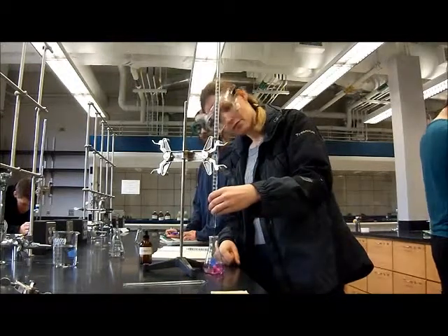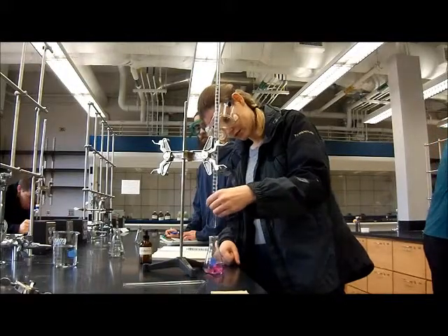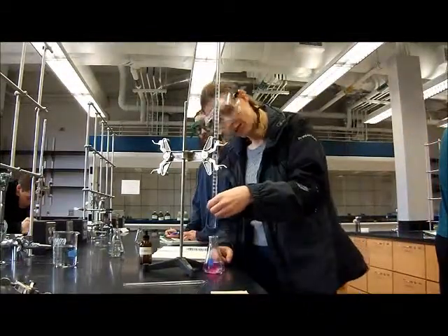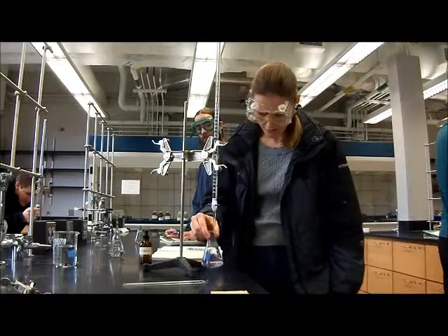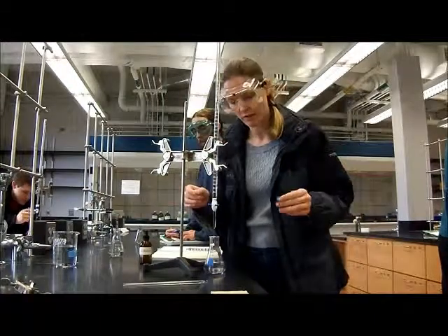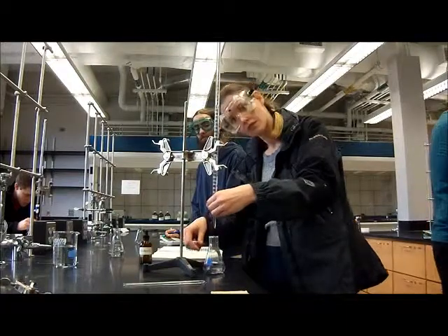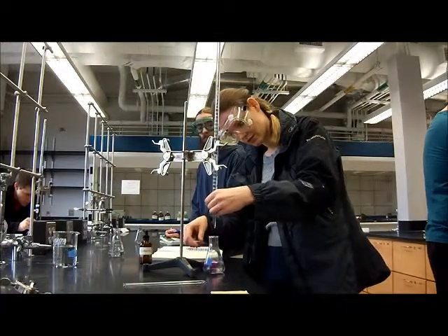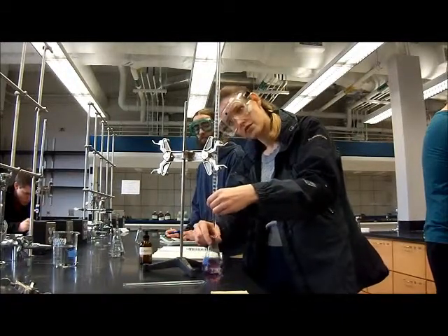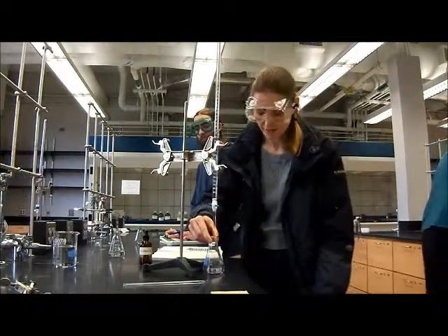So I've now gotten to about 20 milliliters of solution. And as we can see, it's still fairly clear. Okay, I've now reached 25 milliliters, and since I think the endpoint will be around 30, I'm going to start going a little more slowly, maybe 1 milliliter at a time. Okay, that's 26. 27. 28. This is getting very close now.